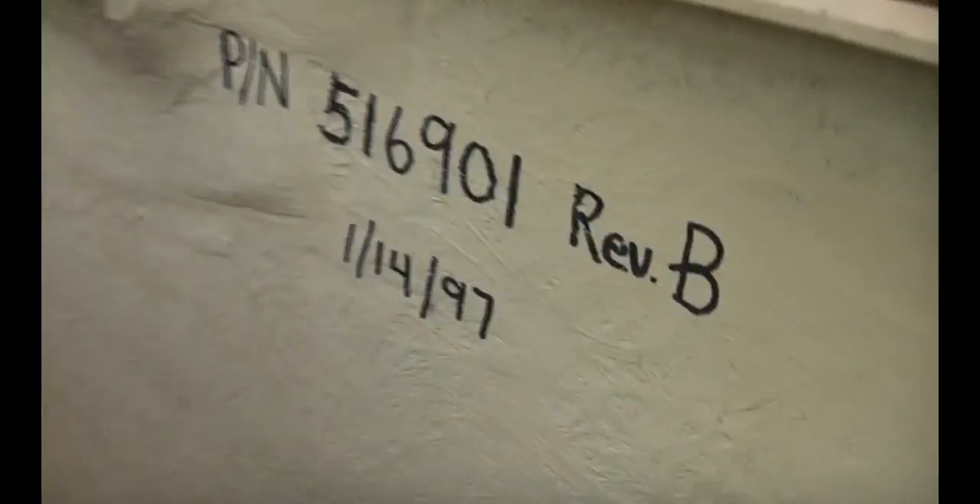You can see it's fiberglass, quite nicely finished. There's a date of 1997. There are actually some pieces of chipboard with a premium stiffener on there - you don't often see wood inside precision equipment, but this one has it. It's the most appropriate solution for kit made in at most hundreds, if not tens, quantity. Whatever the most practical solution to make a nice-looking case - because if people are paying a fortune they want it to look nice.